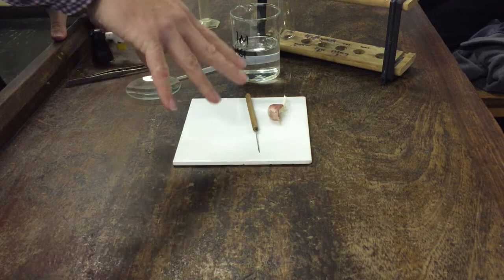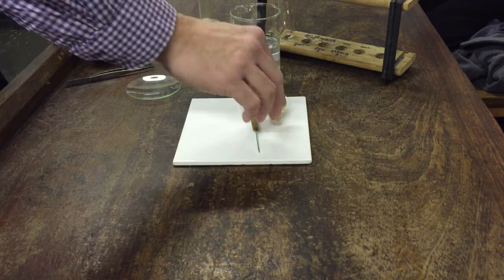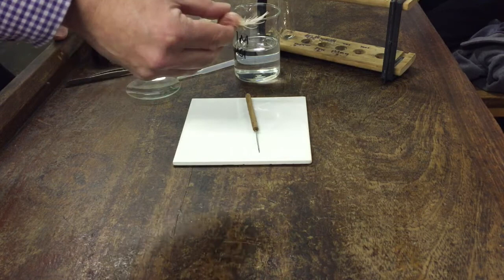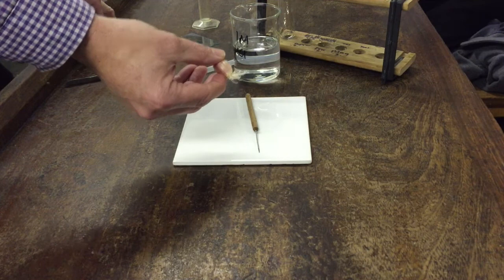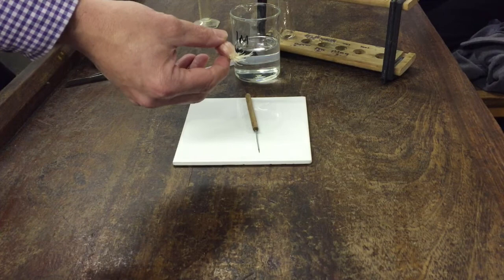Okay, so today we're doing a core practical on how to use a microscope to see the stages of mitosis. It's all about preparing a slide of something where we've got some cells which are undergoing mitosis and what we use is the roots of a fast growing either onion or garlic clove.